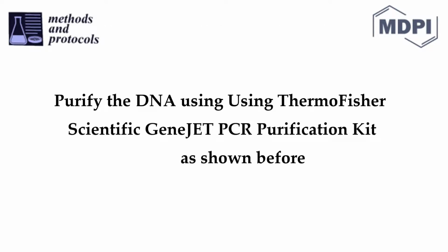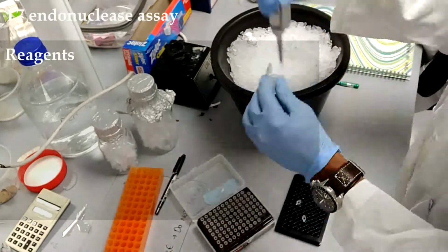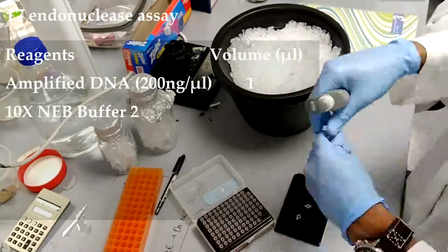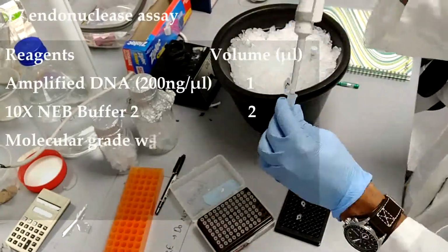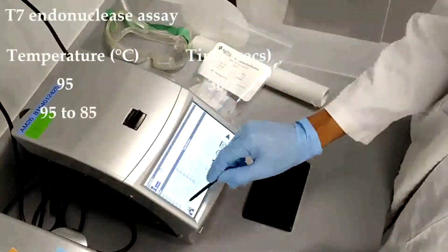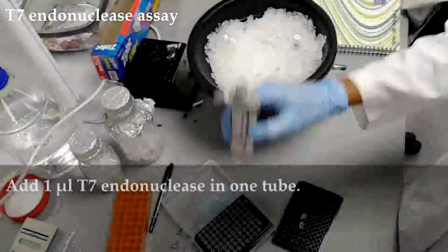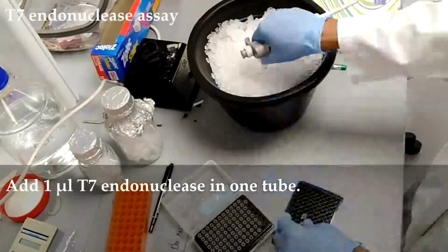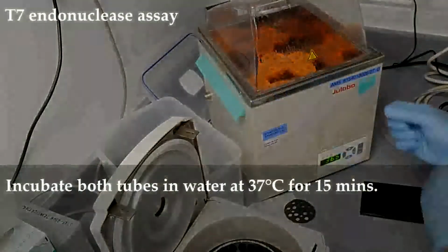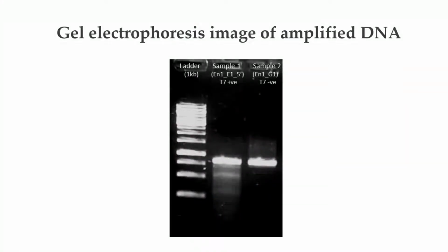Purify the DNA as shown before. T7 endonuclease assay on amplified DNA. Prepare 2 200 microliter PCR tubes. In each tube, add 1 microliter of amplified DNA, 2 microliter of 10x NEB buffer 2, and 17 microliter of molecular grade water. Set up hybridization reactions with settings as shown on the screen. Add 1 microliter T7 endonuclease in one tube. Incubate both the tubes at 37 degrees Celsius for 15 minutes. Run the PCR reactions in 1% agarose gel.